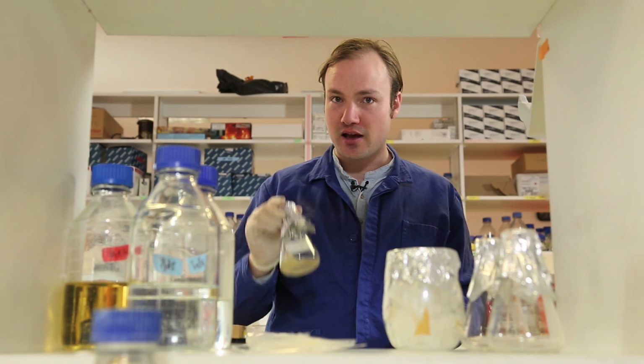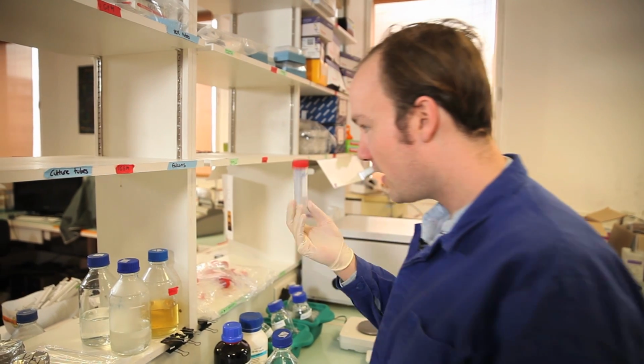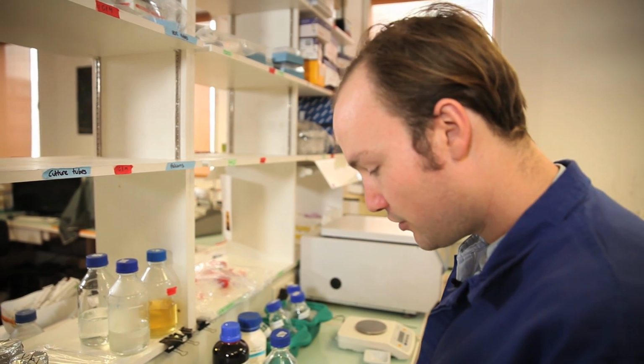It's 2 or 3 hours later, and I've collected my cells from the incubator, and they're at an OD of exactly 0.5. And so they are ready to go for the next step of the competent cell protocol. So I'm going to take my culture of freshly log phase E. coli, and I'll add it to a 50 ml Falcon tube like this.